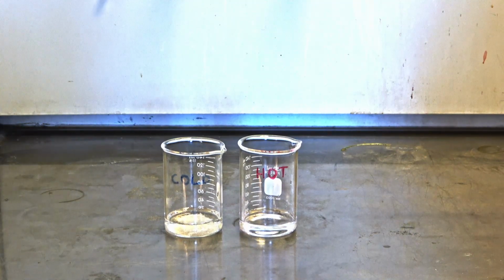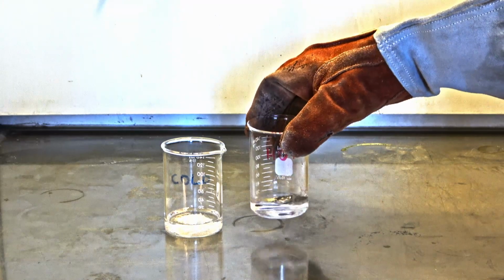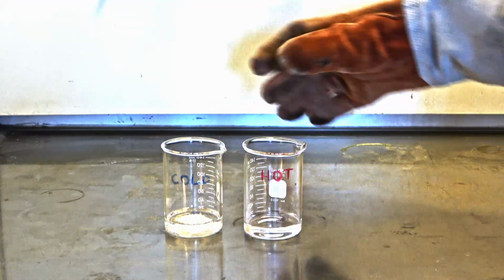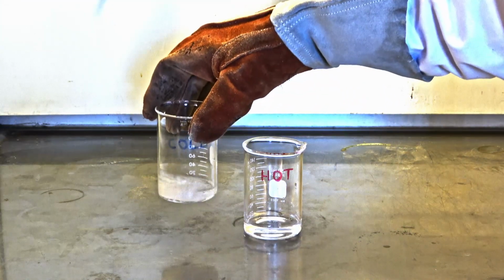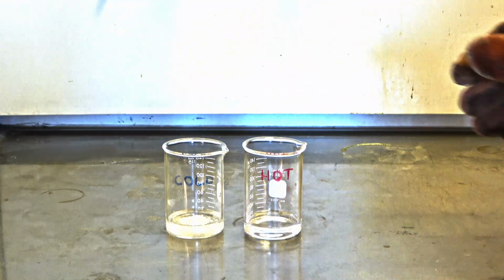The first step is finding a suitable solvent in which the sample can be purified. In a good solvent, the sample should be soluble when hot, but the same solvent should not dissolve the sample at room temperature. If a single solvent that works cannot be found, a two-solvent system should be tested.